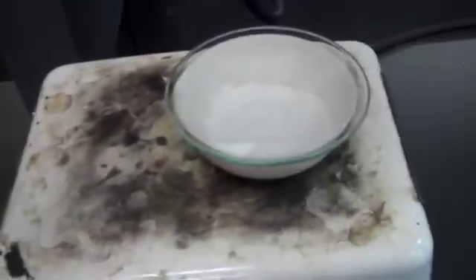When the substance is completely dry, there's no more condensation on the watch glass. Turn off the burner, then carefully remove the watch glass and the evaporating dish using gloves, and allow it to cool.